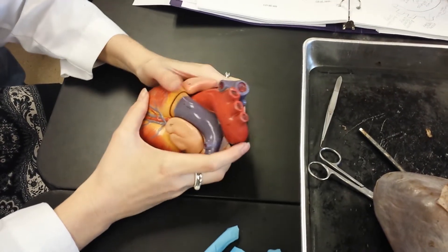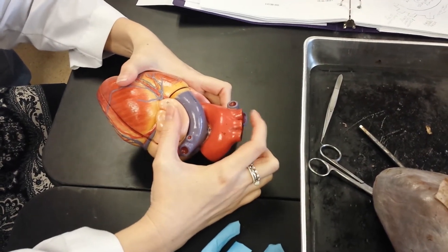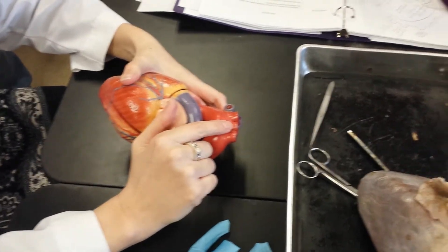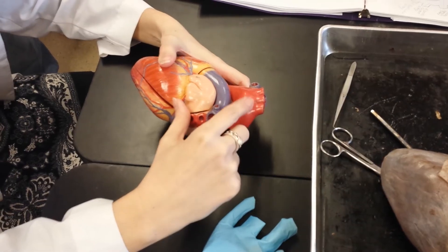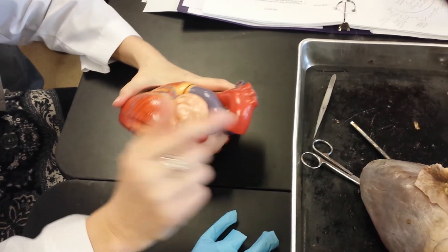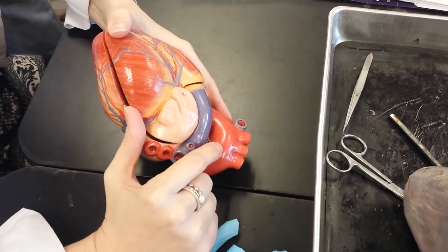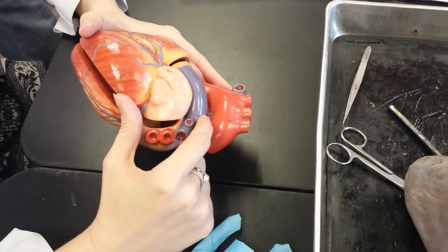Another thing: in the human heart you've got three branches off the aorta. The first one is still the brachiocephalic artery — so it's BCS where the cow heart only has BS. The C stands for left common carotid artery, and then this is the left subclavian artery. Between your pulmonary trunk and your aorta, that little white thing there is the ligamentum arteriosum.